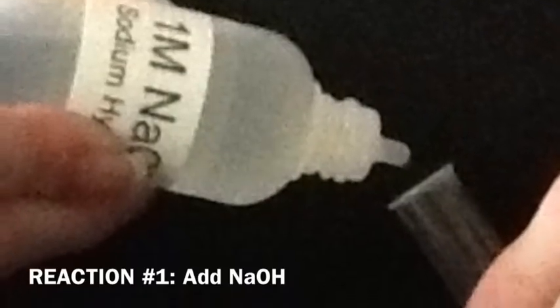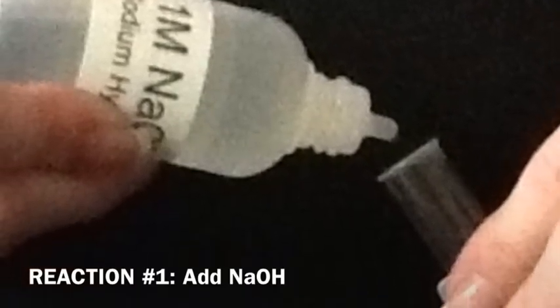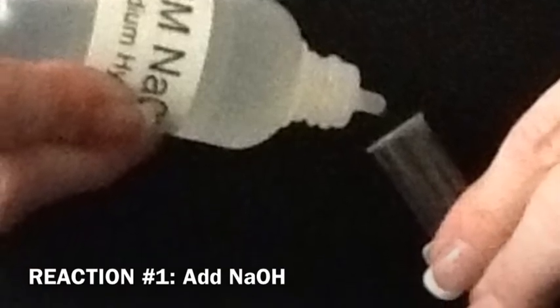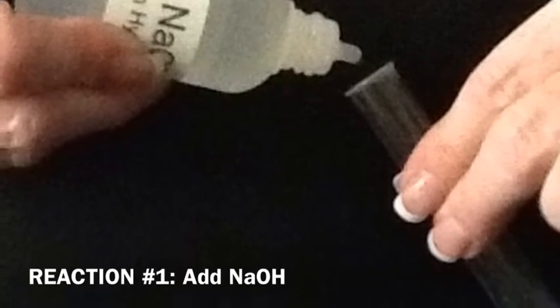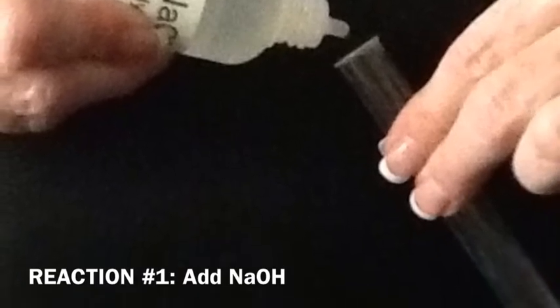For the first reaction, you're going to add 10 drops of copper 2 nitrate to a clean, dry test tube, and then 20 drops of sodium hydroxide, which is also aqueous, to the test tube.